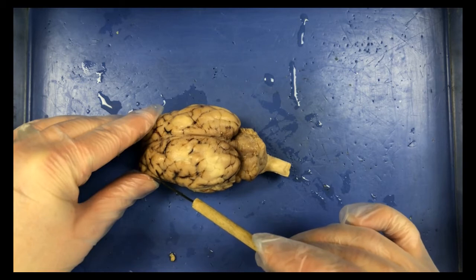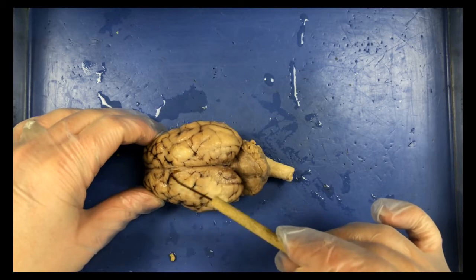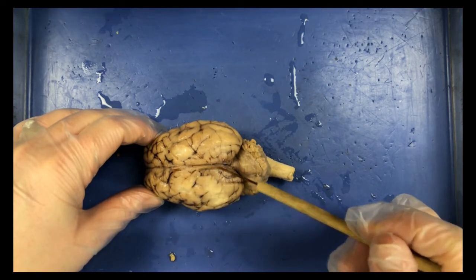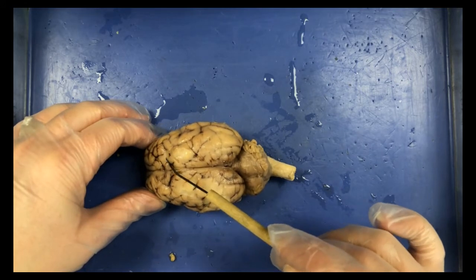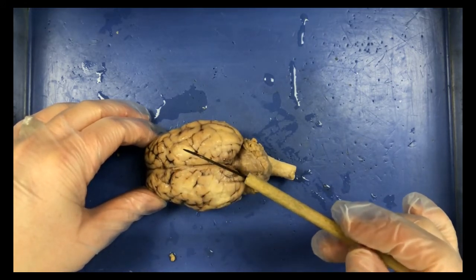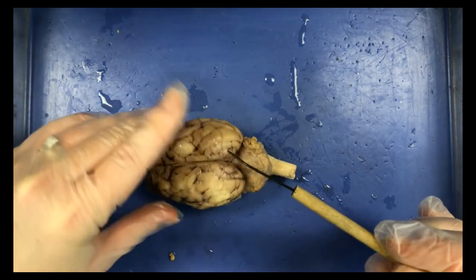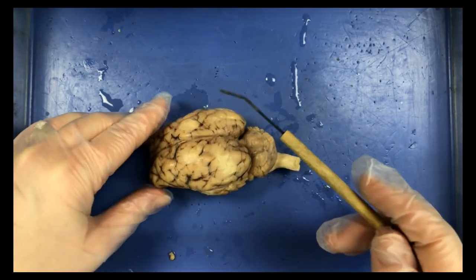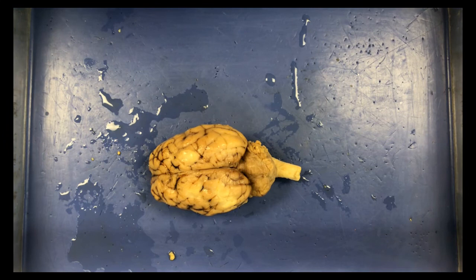So you should see these ridges, should see the grooves, and you'll notice there's some dark material here, or it almost looks black. Those are just blood vessels, so that's just blood and blood vessels on the brain there. But a lot of times you can see them in the grooves. So think about what those ridges and grooves are called, how they look different, and when you're touching the brain, how does the surface of the brain feel? So take notice to how you think it feels when you touch the brain. So that all dealt with the superior view of the brain.